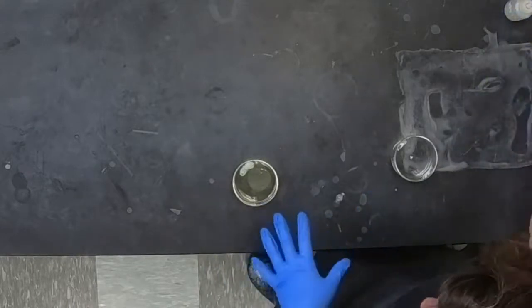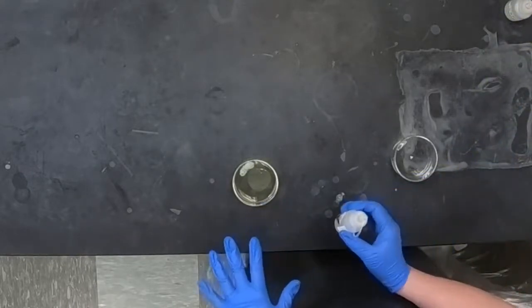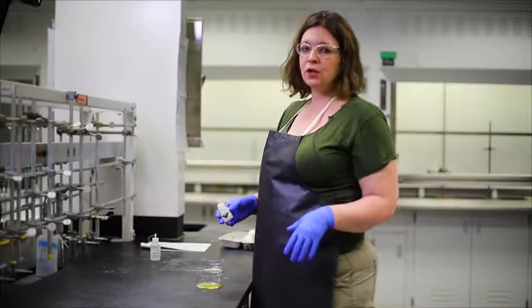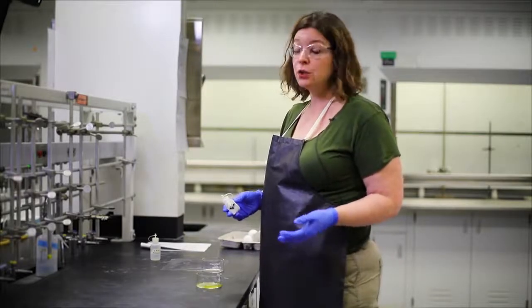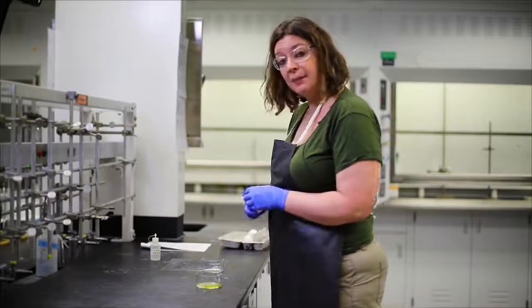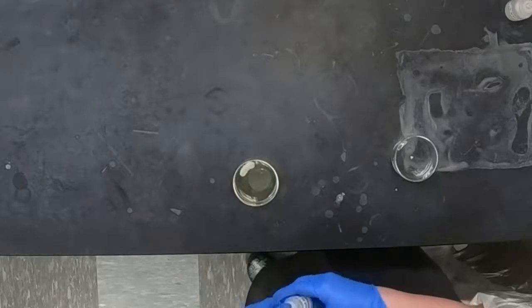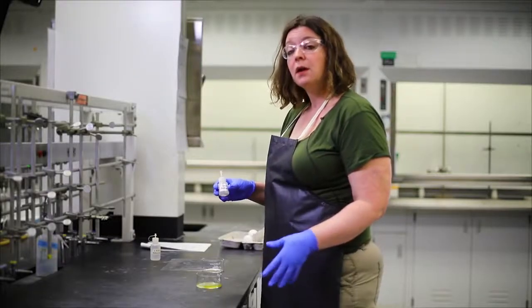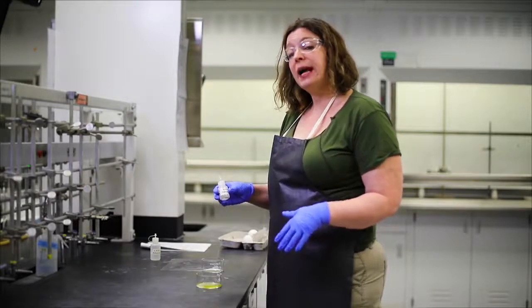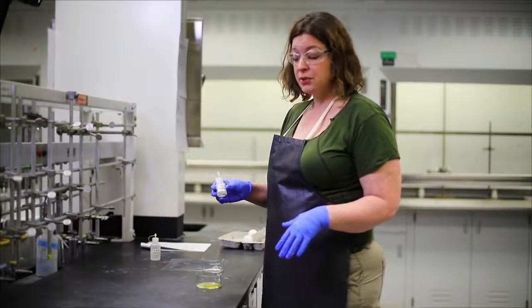And you can see right away something is happening. If you have ever accidentally touched your eye while you've got acid on your hand, when you've got vinegar on your hand, you know that this burns. We're chemically burning your eyeball, or your egg white in this case. This is one form of corrosion. Things that are basic, things that are alkaline, also are corrosive.